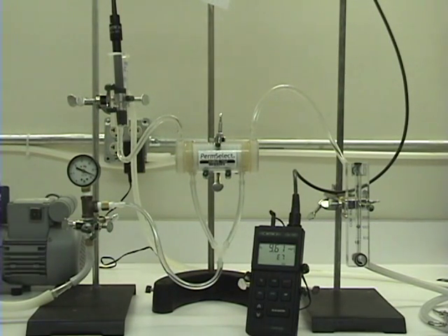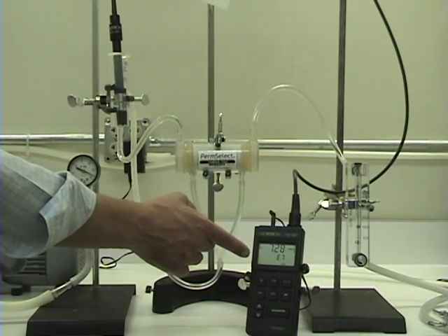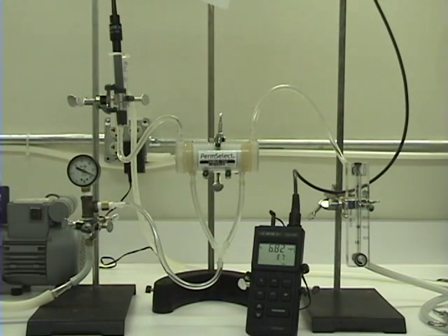We initiate vacuum by turning the vacuum pump on. As seen here, the total dissolved oxygen begins to drop.